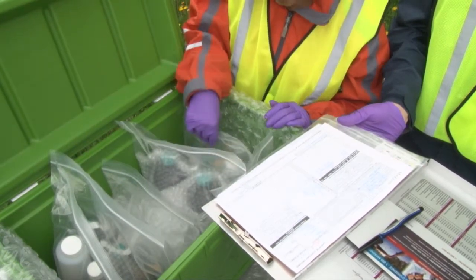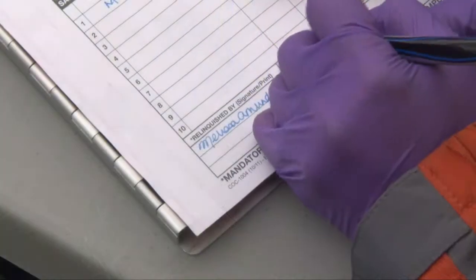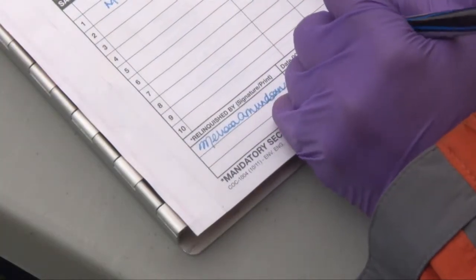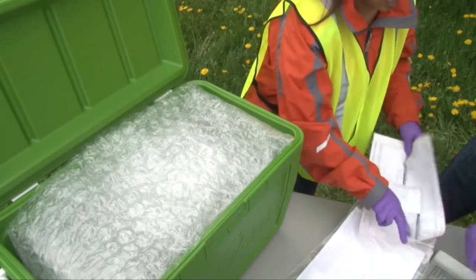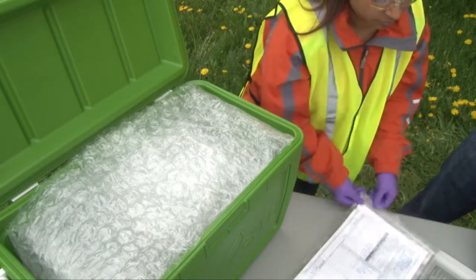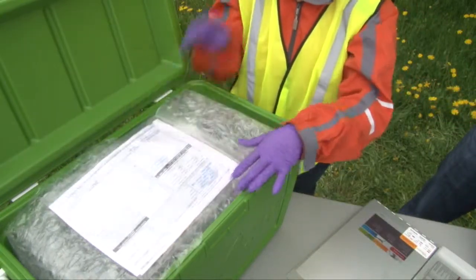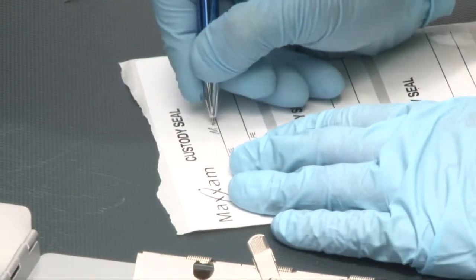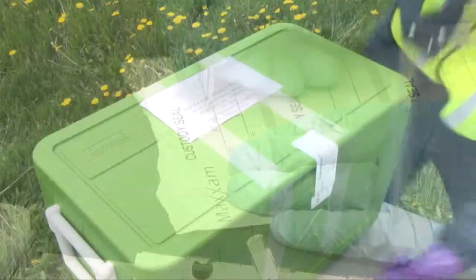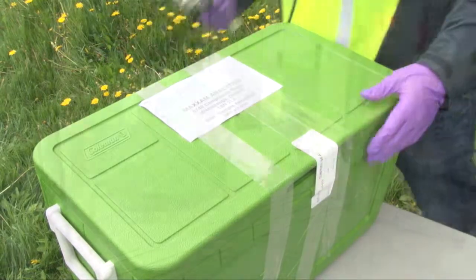When you have cross-checked the COC and are confident that your project is complete, please sign, date, and write down the time you are packing up the cooler. Then put the finished COC in its resealable bag, lay it on top of the final layer of bubble wrap, and seal the cooler. If applicable, sign and date the custody seal and add a final layer of packing tape on top of the custody seal.